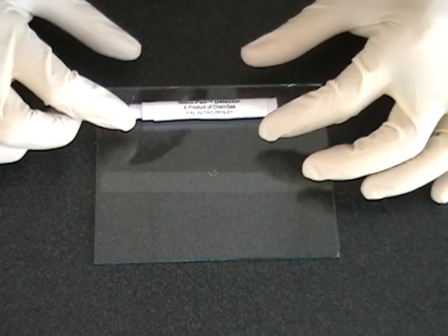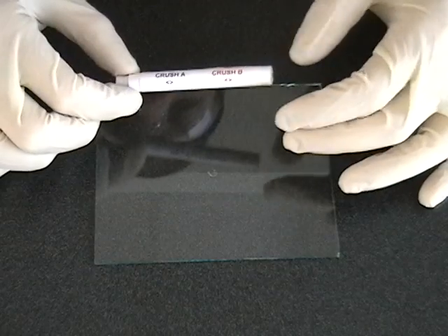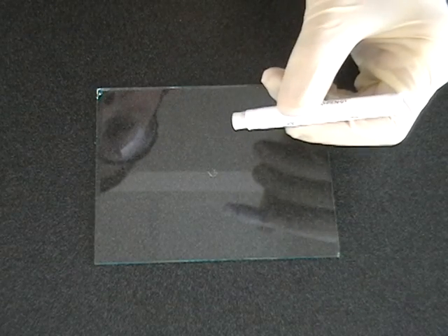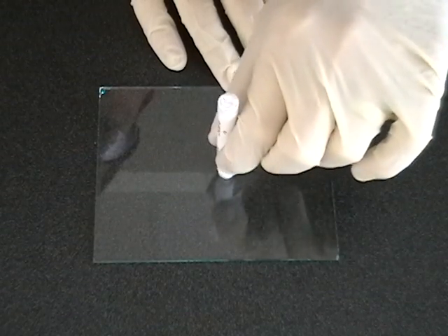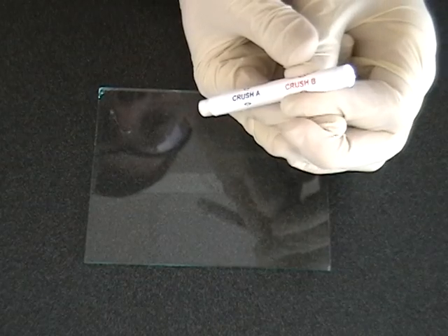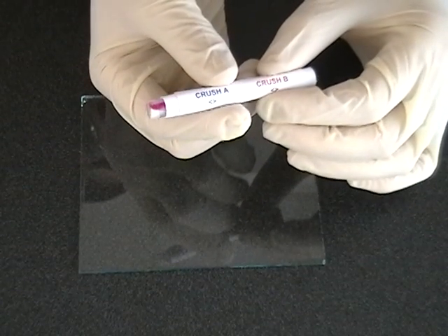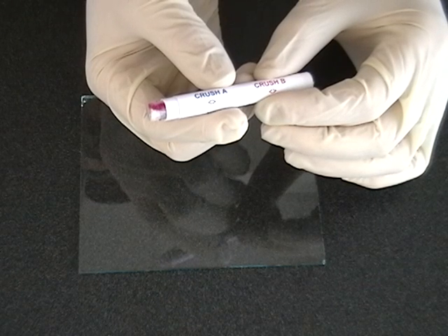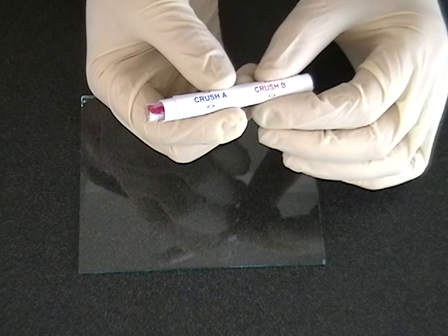We are now going to demonstrate the detection of an aliphatic nitro organic or nitramine. For this test, we are going to use a simulant for RDX, a common nitramine explosive. Again, press firmly on the location marked A on the nitro pen, breaking the ampule inside. Allow the liquid contained in the ampule to flow to the tip of the nitro pen. Rub the suspect surface, collecting any suspicious powders or residues which may be visible, and wait 30 seconds. Since no color has formed on the tip of the detector, we can move onto the detection of aliphatic or nitramine explosives. Press firmly on the location marked B on the nitro pen, breaking the ampule inside. Allow the liquid contained in the ampule to flow to the tip of the nitro pen and mix with the liquid from ampule A. Wait 30 seconds. If a pink or red color forms on the tip of the detector, as you can see here, there is RDX or another potentially explosive nitramine or aliphatic nitro organic on the suspect surface.